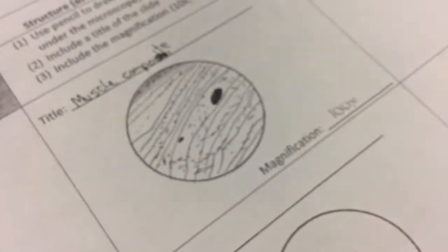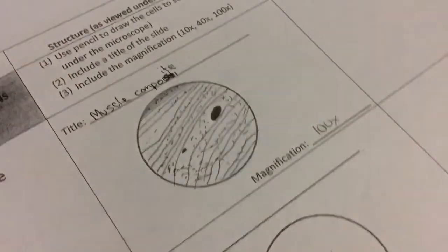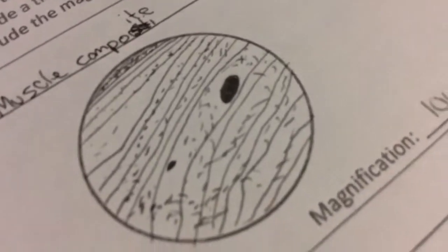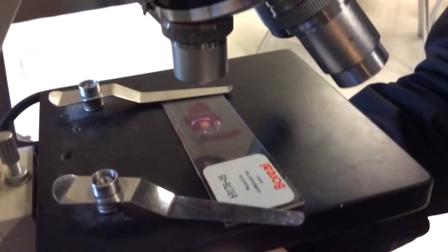I can see it! What? If you stop moving it. Now, that is how you draw. Wow, titles there, magnifications there, but look at the detail. Look at that.